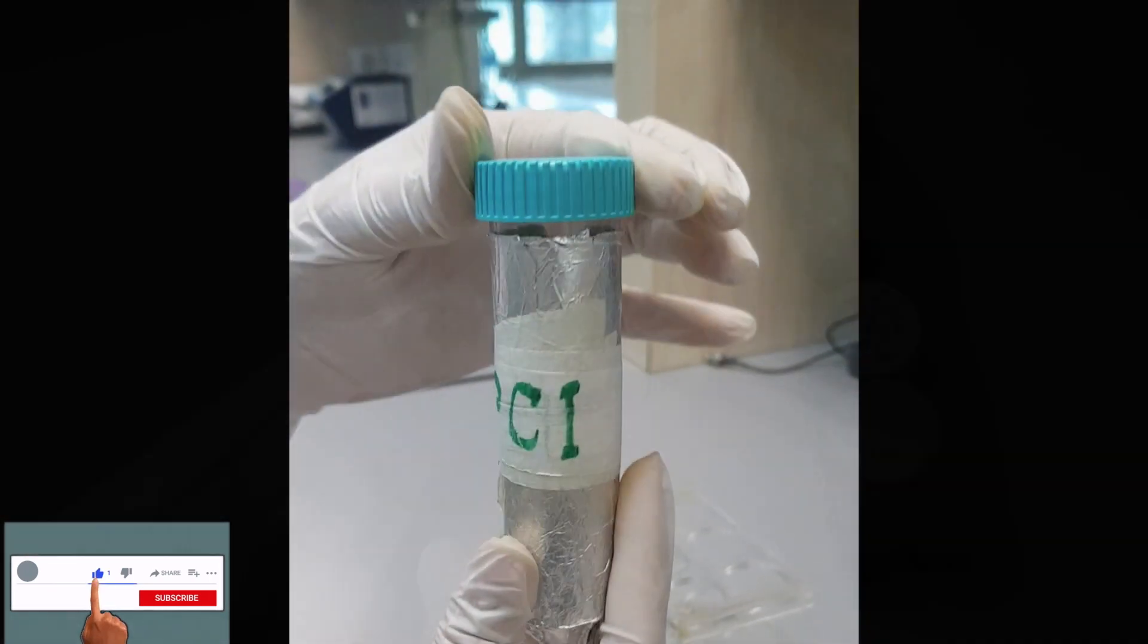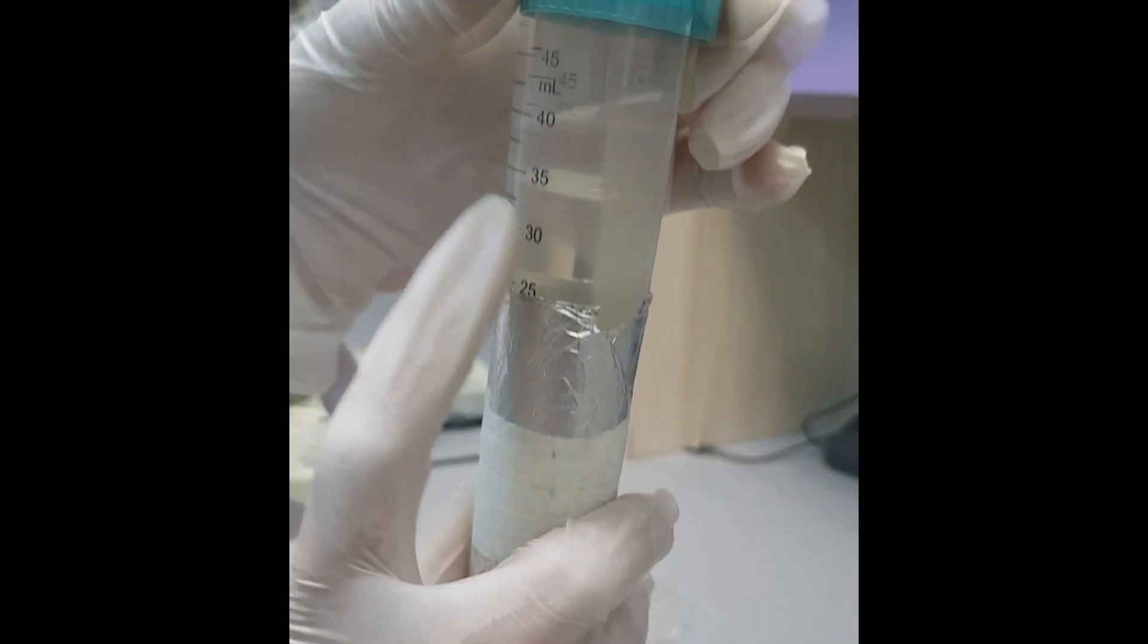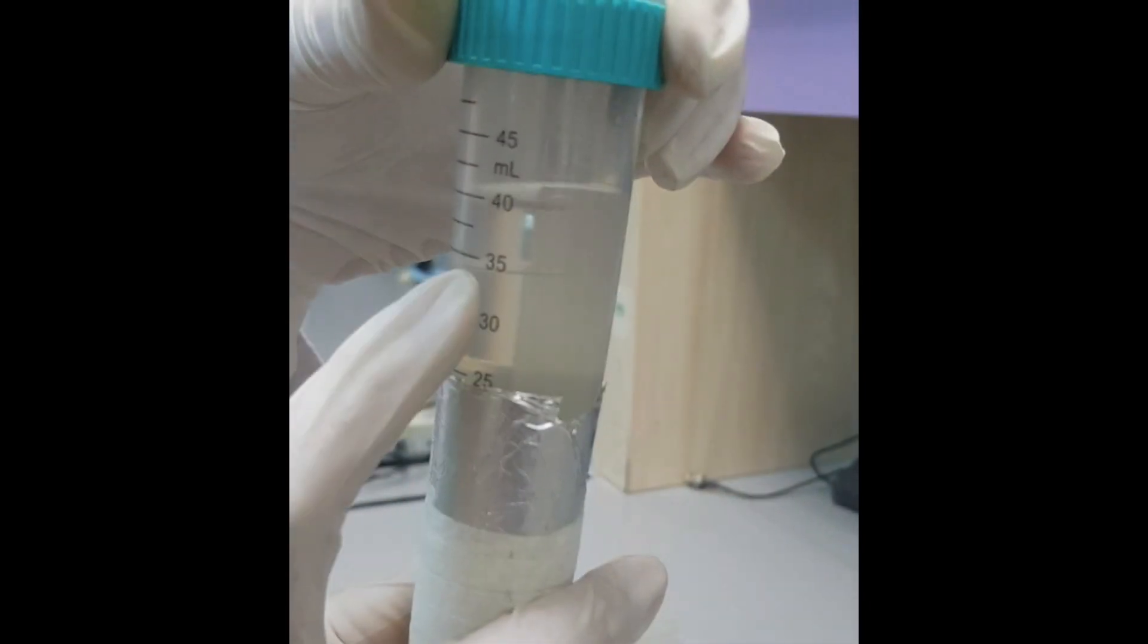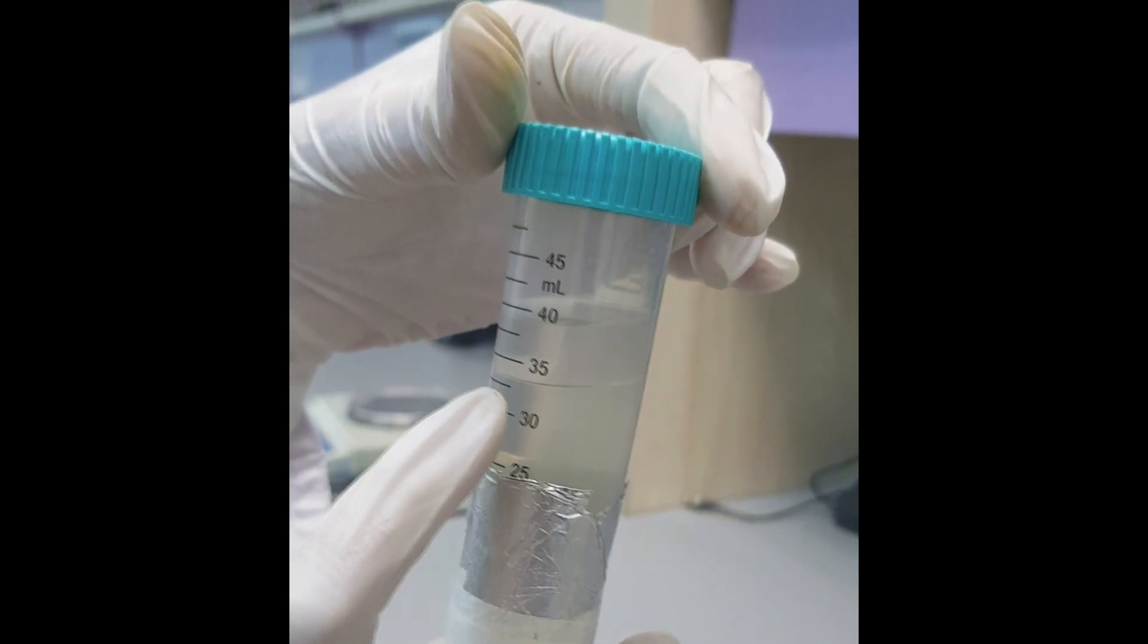Within a day, you will be able to observe two distinct transparent layers of PCI. We will be using the bottom layer of PCI for our DNA extraction.